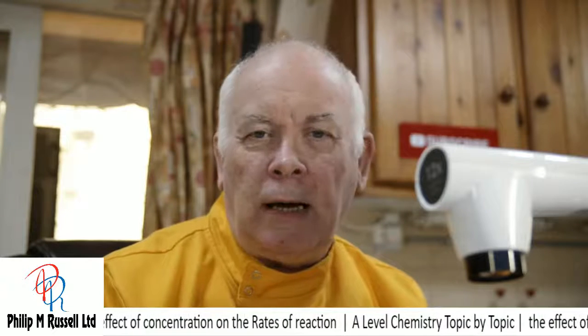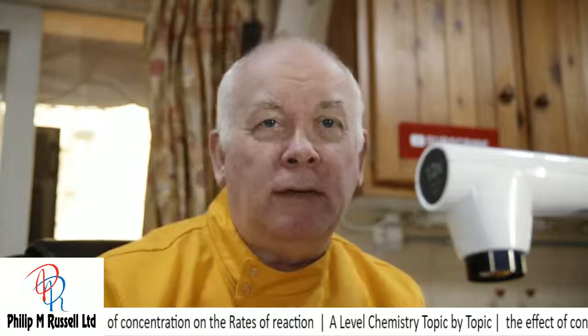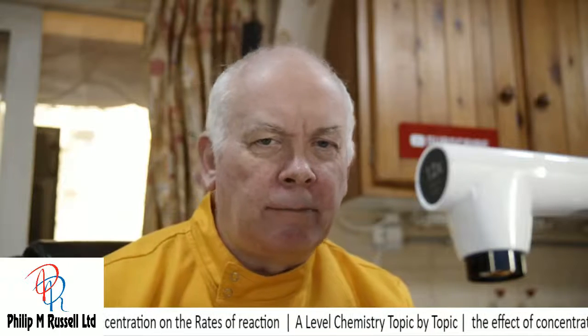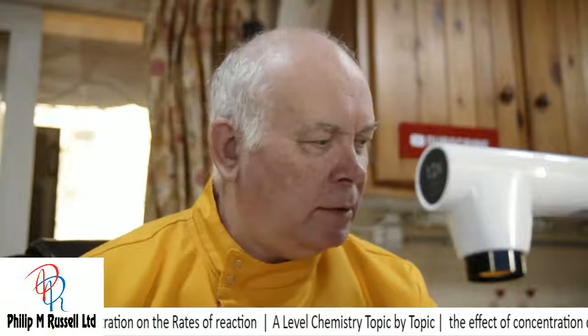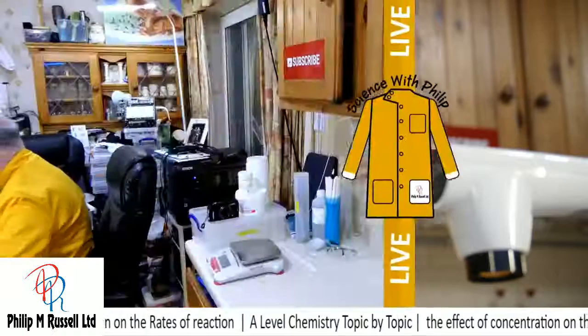So we're going to have a look at the system called the iodine clock, and we're going to have a look and see what it is, what it does, and how we can measure it. So let's go over and have a look at this and start having a play.